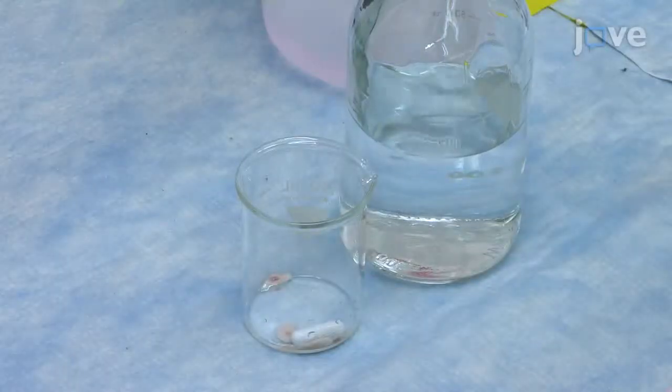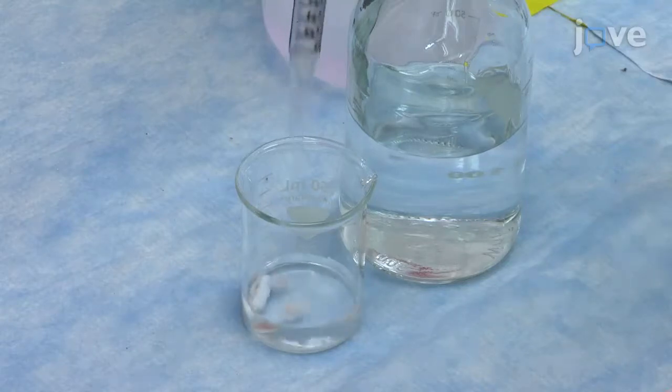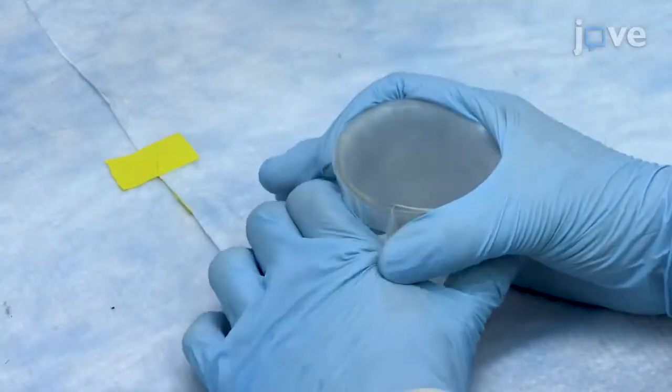Remember to cool the mortar before placing the tissue inside to mill. A warm mortar may lead to incomplete milling. Use caution when handling N-propanol and pepsin. Only open N-propanol and other decellularization reagents under a chemical hood. If possible, weigh the pepsin under a chemical hood as there is danger of inhalation.